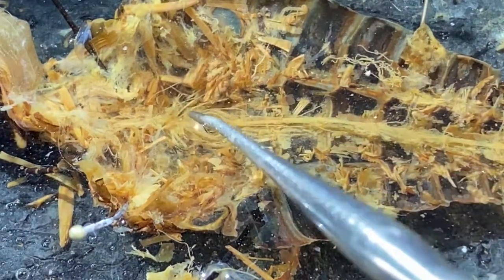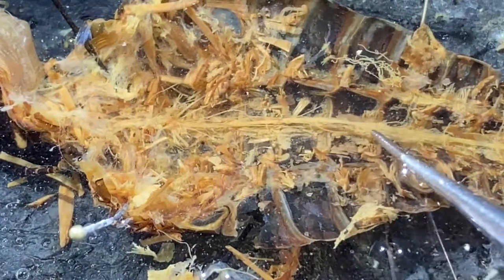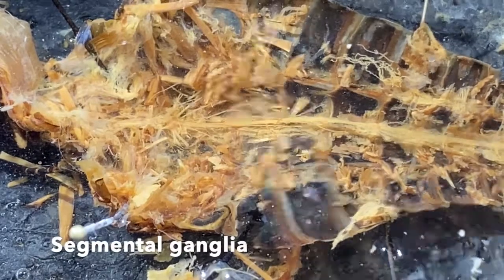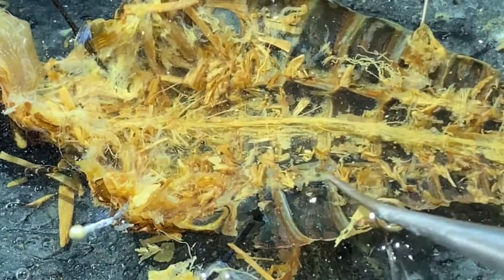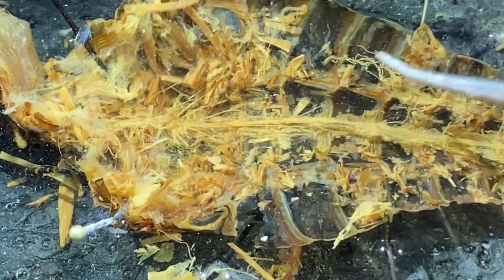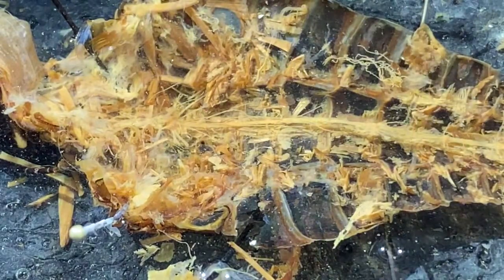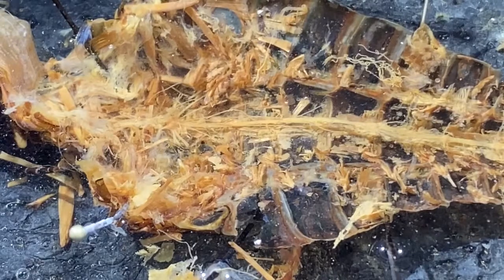If we come back more posteriorly, we can see periodically slight enlargements along the way. These are segmental ganglia in the nerve cord. Now this line right here and this line right here, these are the articulation points between the ventral and dorsal plates of the exoskeleton. And that is the internal anatomy of the grasshopper.